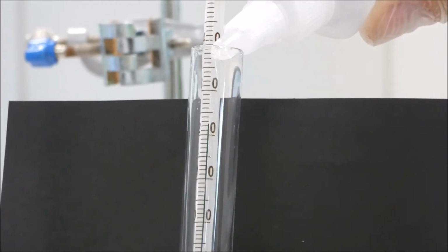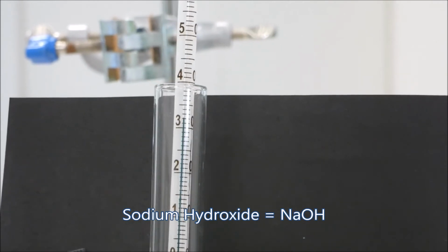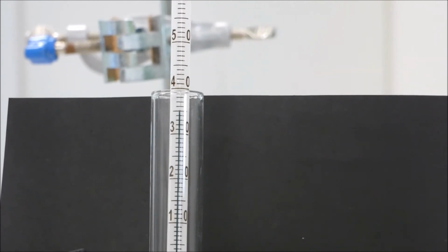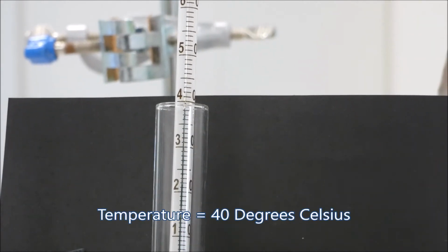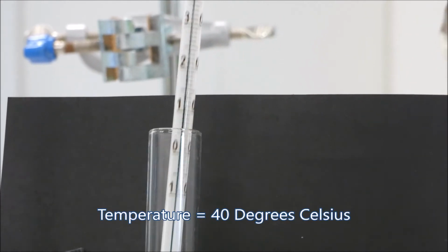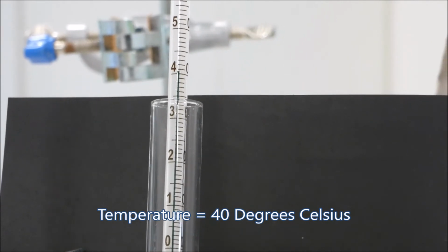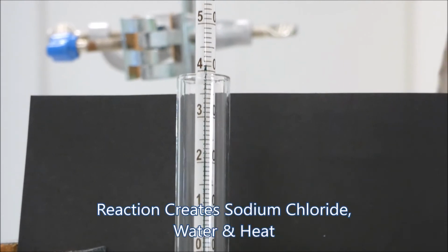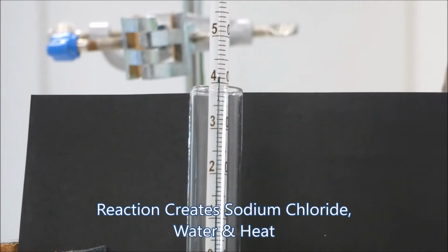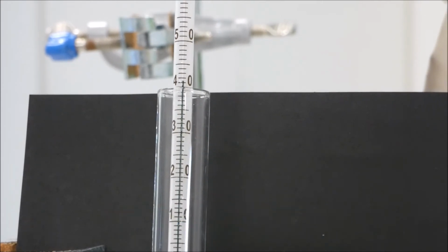So we'll add the sodium hydroxide, and if you look at the thermometer you can see the temperature rising quite dramatically. It's now approaching about 40 degrees, so if we give it a bit more of a stir we might get a bit more. So yeah, about 40 degrees it's gone up to. So it shows that a chemical reaction has taken place and that we've got sodium chloride or salt forming plus water with the release of heat.